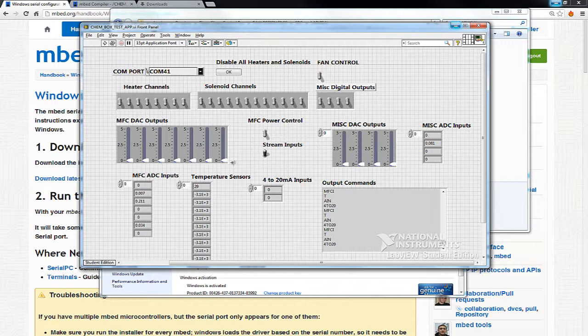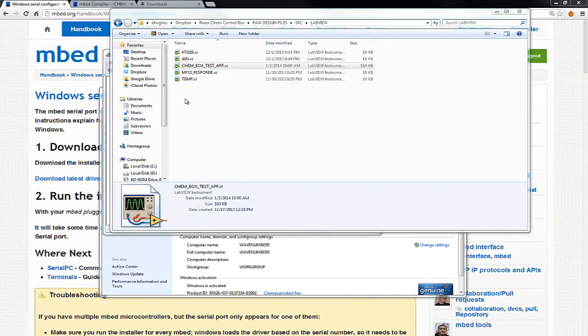Now, the advantage of the Chem control box is that we could put the whole control system in the mbed itself, so it's nice and stable, and you don't have to worry about a PC crashing, and just use the LabVIEW interface for the monitor. But this is an example. So what we're going to do now, let me close this up.